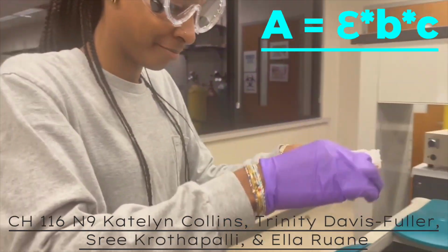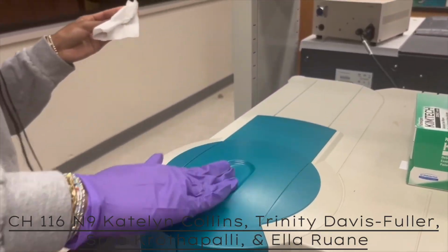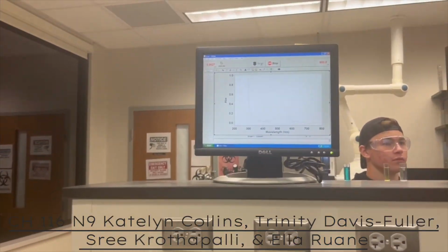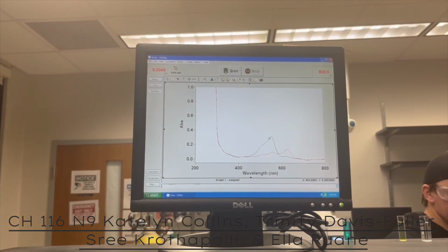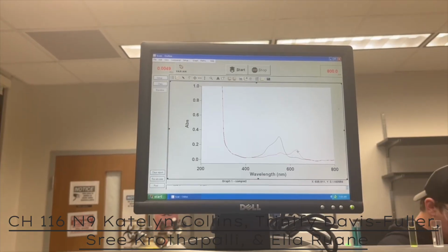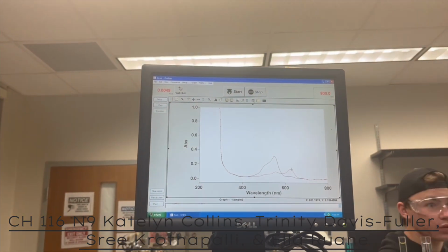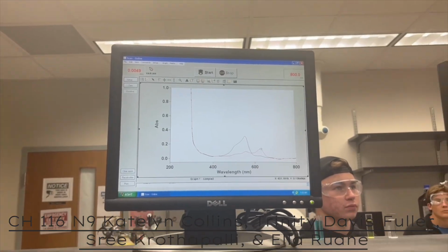According to the Beer-Lambert law, absorbance and concentration have a linear relationship. In other words, as concentration increases, absorbance will also increase in a linear pattern and vice versa, so long as the machine and graph setup is done correctly. A crucial part of this setup is carefully wiping every cuvette clean of fingerprints and zeroing the machine. We do this using a cuvette filled with the same solvent as was used to prepare the solutions.